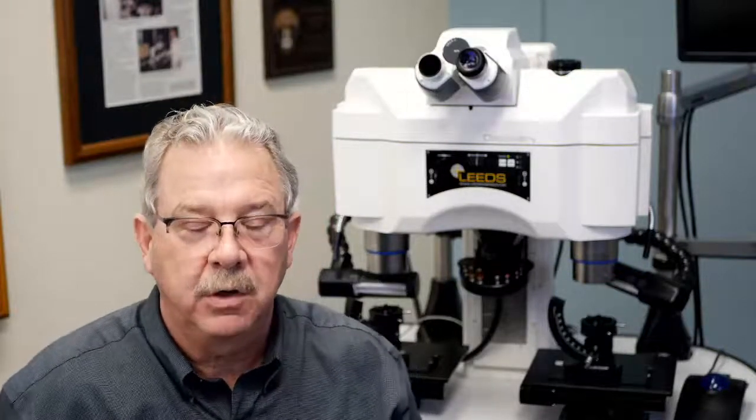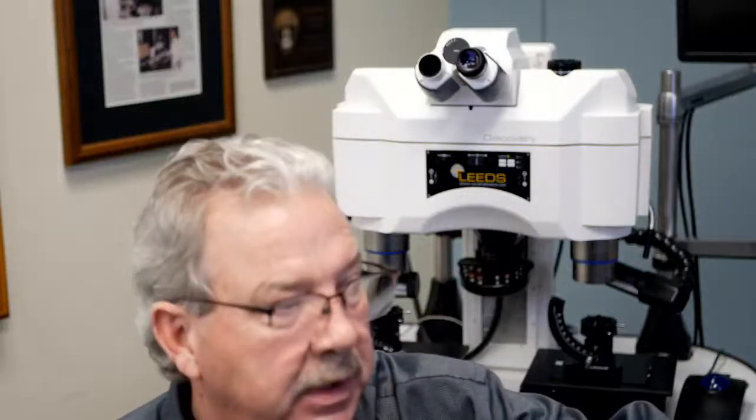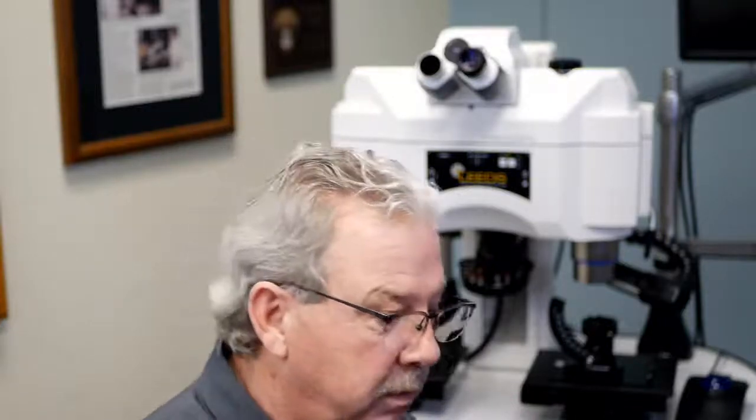So it's easier on us to sit in front of the microscope because we've pulled back away from the eyepiece and we don't need to hold our head and neck so rigidly to maintain a nice sharp field of view in the microscope. In fact, in this particular case where you're seeing that set of glasses, they're saying that the eye relief, the amount that you're going to sit away from the eyepiece, is sufficient that you should be able to wear your eyeglasses while looking through the microscope if you want to.